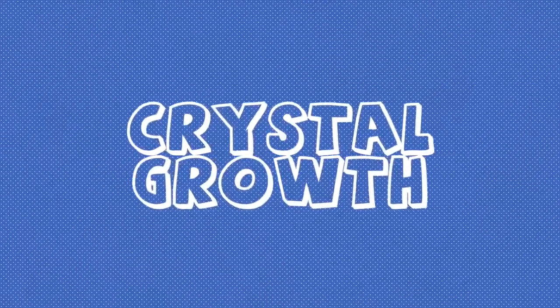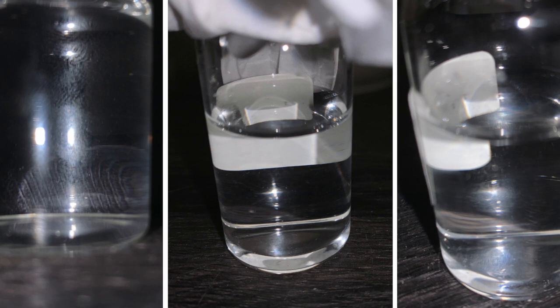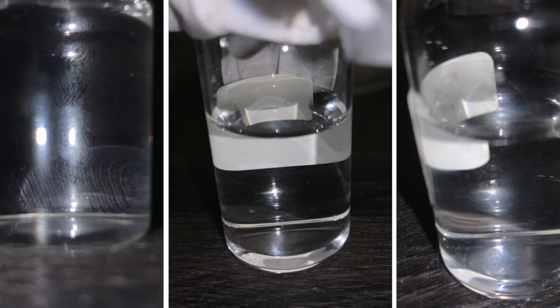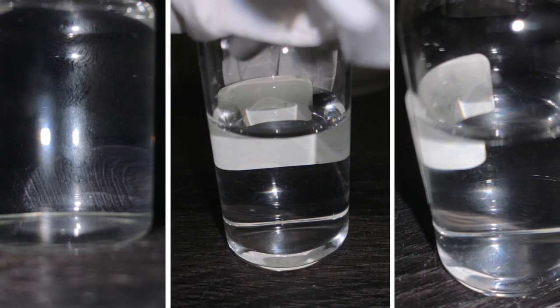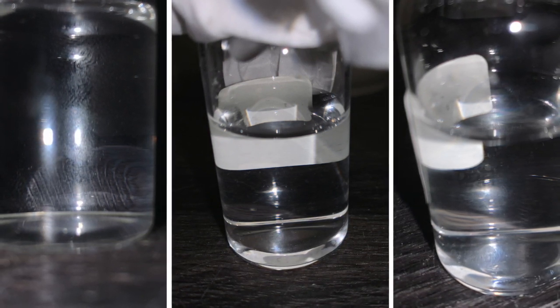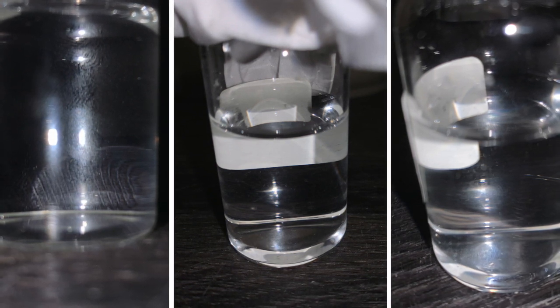First is crystal growth. I still have not seen any crystal growth. There are a few really small particles in the tube, but they're hard to see in the images, and it's hard to determine whether they're small crystals or just dust particles. I think there are a few possible reasons why there are not any super visible crystals growing.